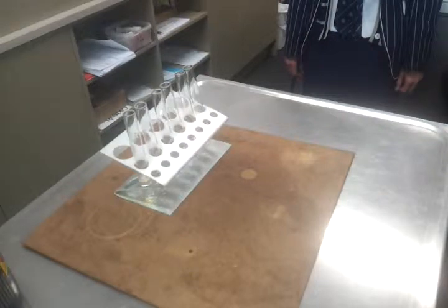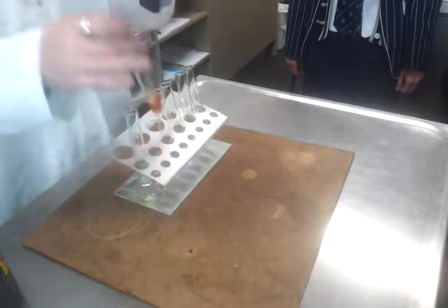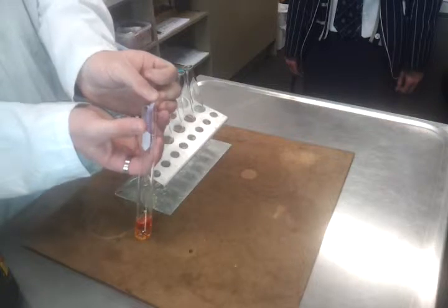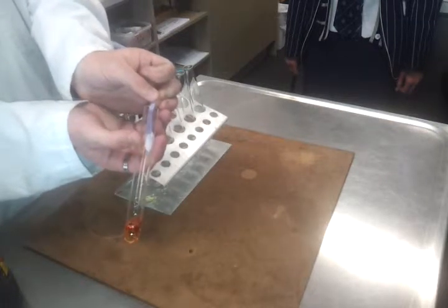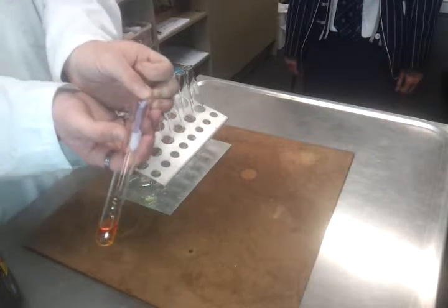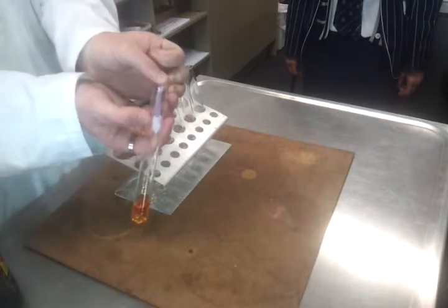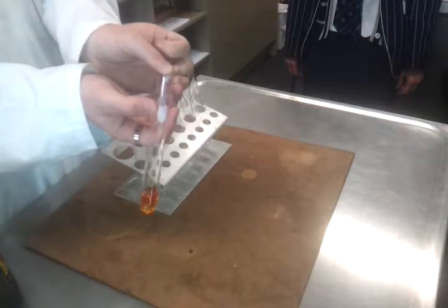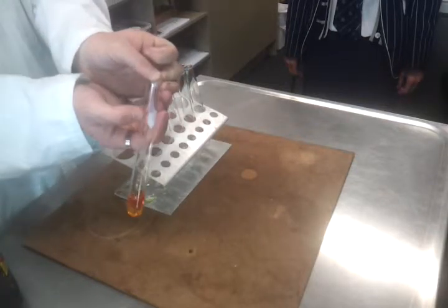I'm going to make it damp. So blue litmus paper, sorry, I should have been specific there. If this goes red, then it is actually reacting, just not at a rate that we can see. And nothing. Absolutely nothing. So that's a confirmation that no, there's no substitution happening there, or if there is, it's so slow. There's not enough activation energy there, as it were.